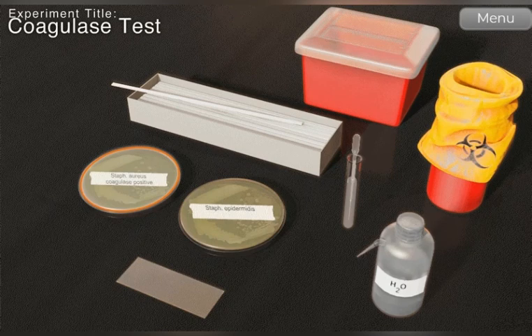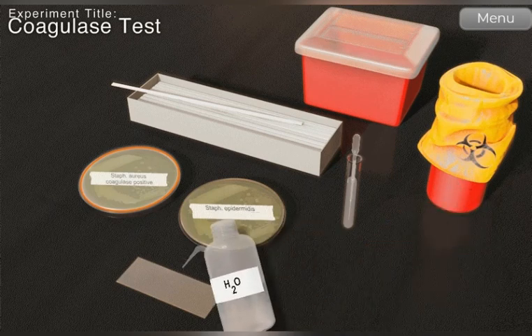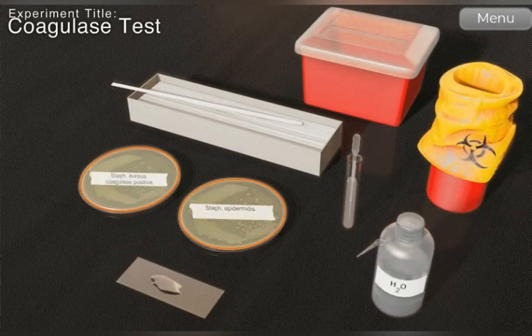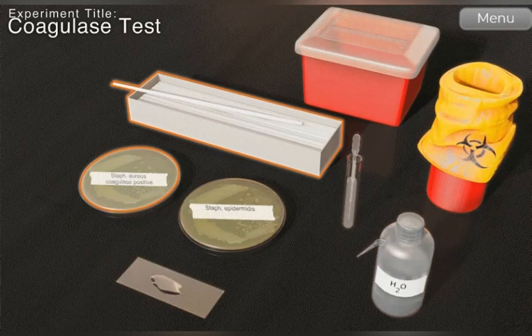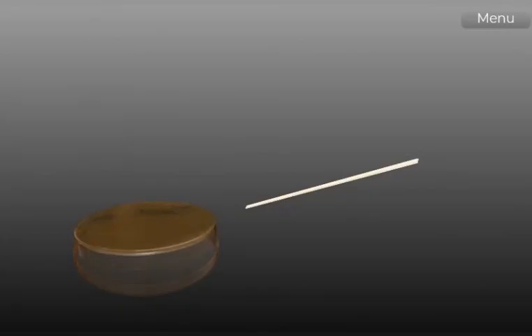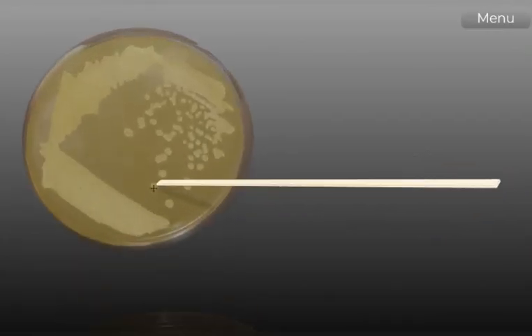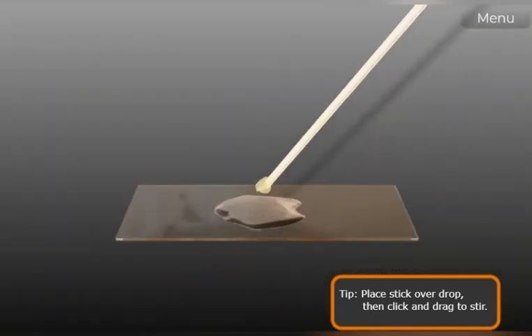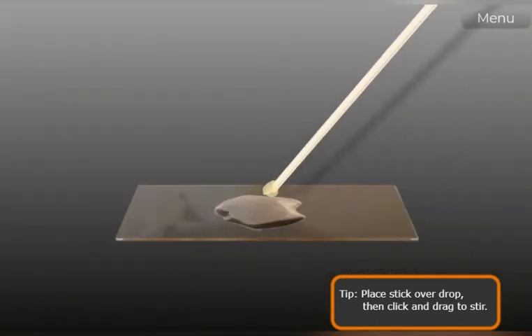Next, do the same procedure. Put some water on the slide and then pick isolated colony using the stick. And then mix bacteria into water.